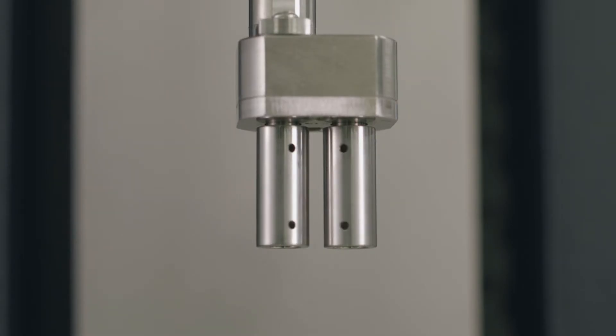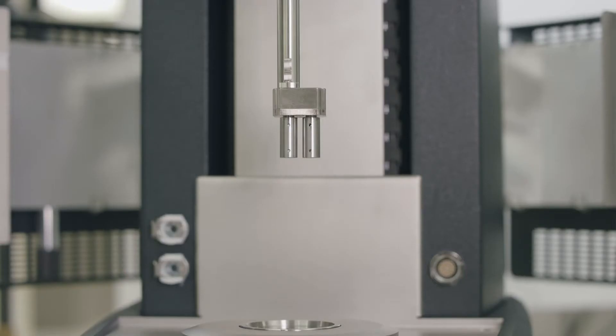Rotate the drums, lock the motor, and insert the clips.